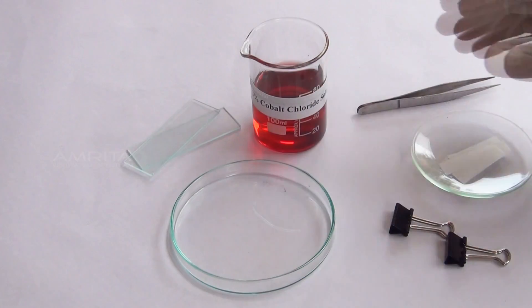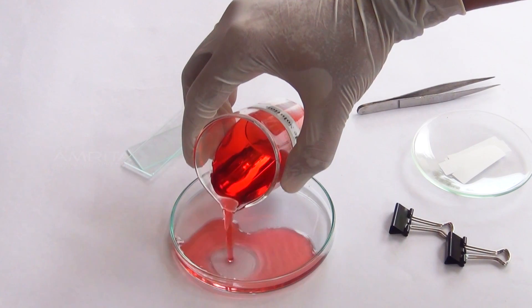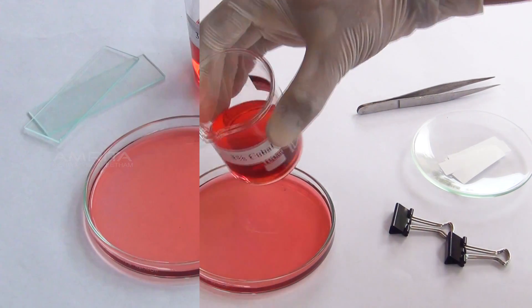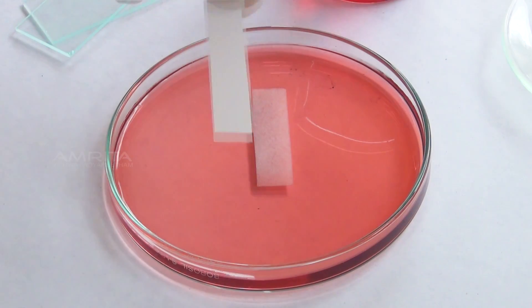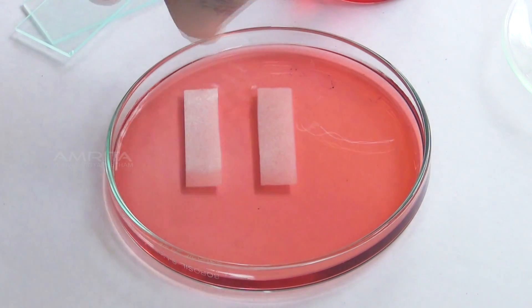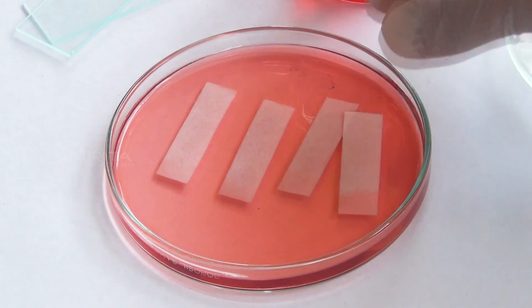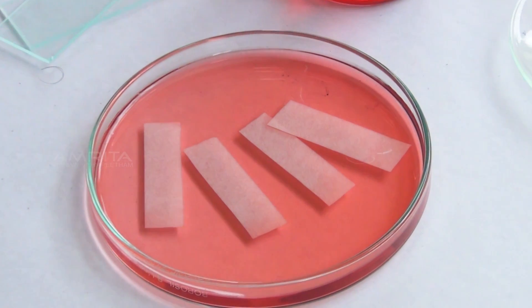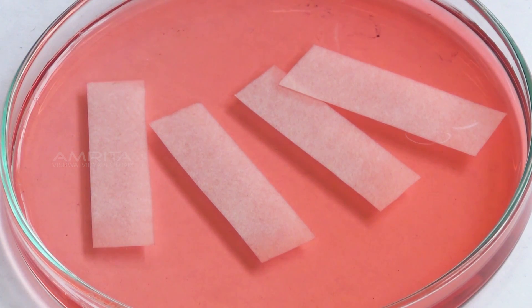Procedure. Take 3% cobalt chloride solution from the beaker and pour it into the Petri dish. Take some filter paper strips and dip them into the cobalt chloride solution. Keep the strips in the solution for 3–5 minutes. They become pink in colour when wet.